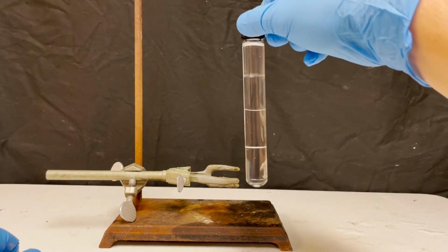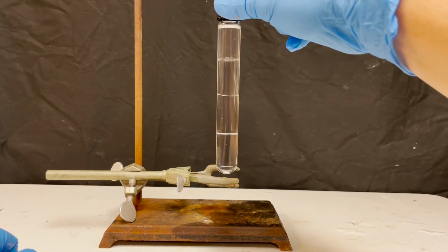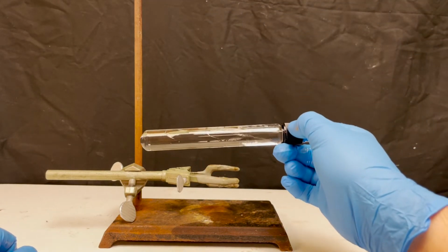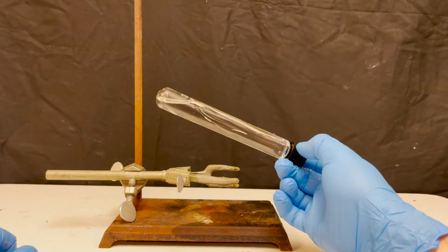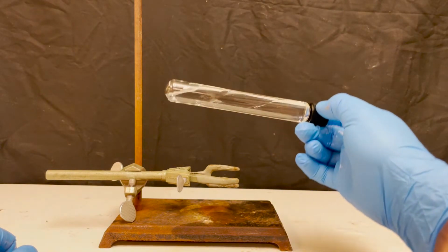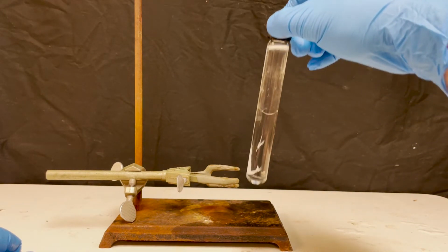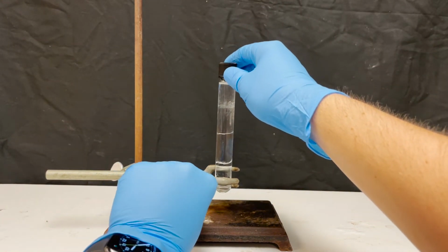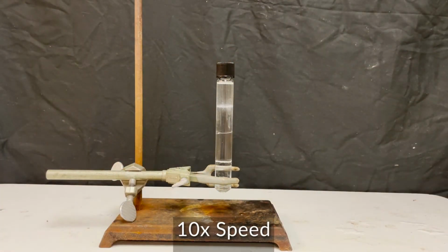If I take this tube and gently mix it, we can see that the layers swirl, but do not mix. Letting it sit for a few minutes allows the layers to reform.